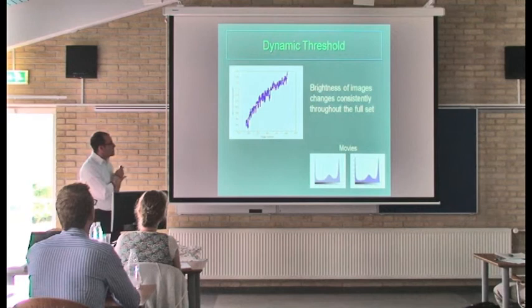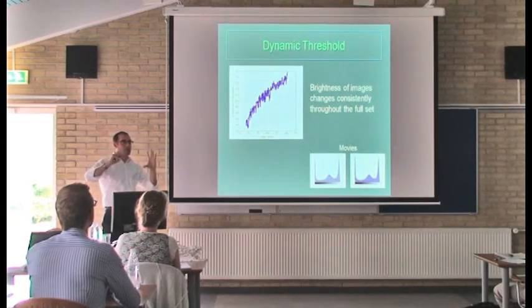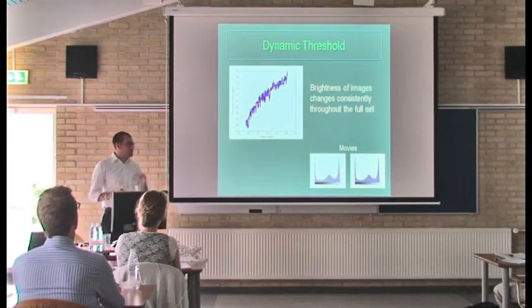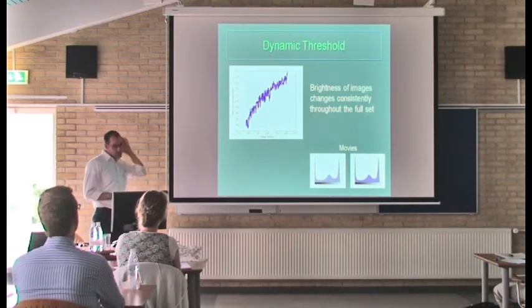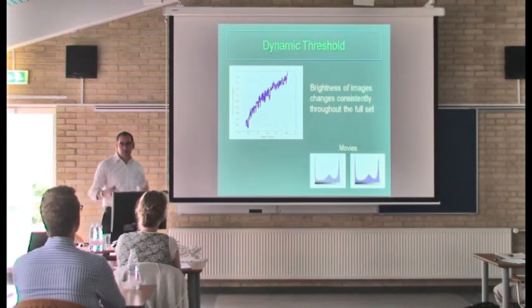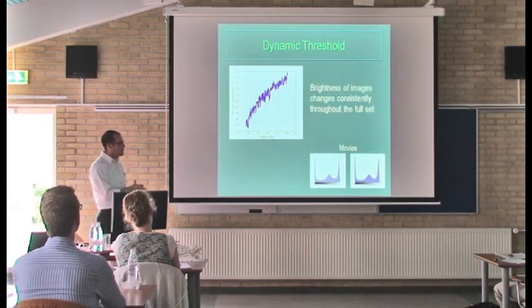I think this is the last image processing highlight I'm going to show. So we showed that you get sort of illumination changes on a single image, but you can also, throughout your set of images, get changing brightness between all your images. And this is something actually that kind of came up on a recent data set we got. A lot of our earlier ones, we didn't see this, and not really sure why it happens. It could just be a function of the detector you're using. You're milling out more material, so it's kind of a bigger trench, and so you can get more electrons out. But generally, the brightness was increasing. This is image number as you go further along the data set.